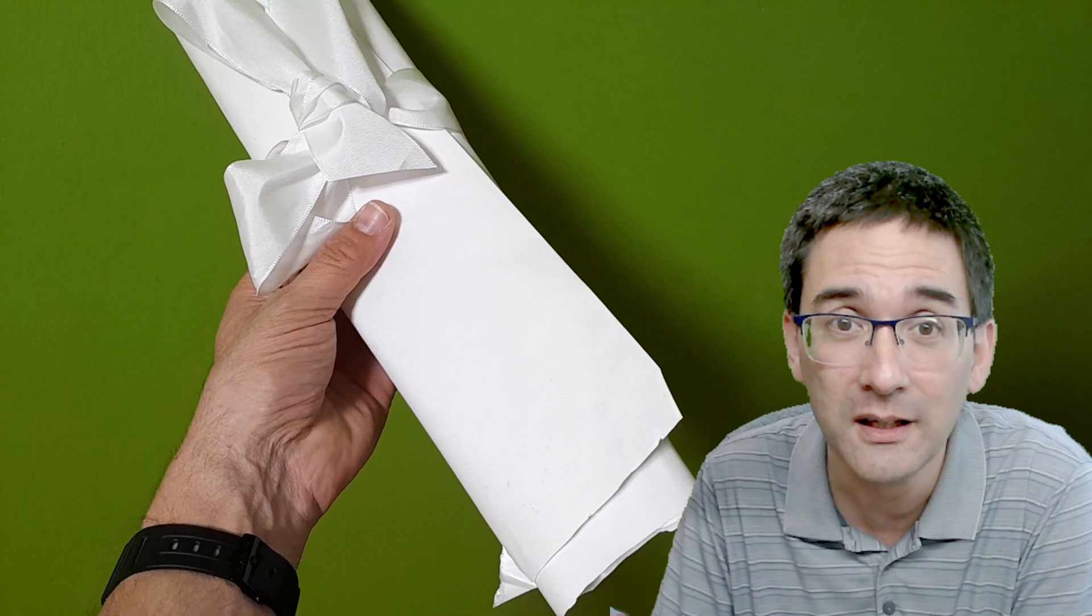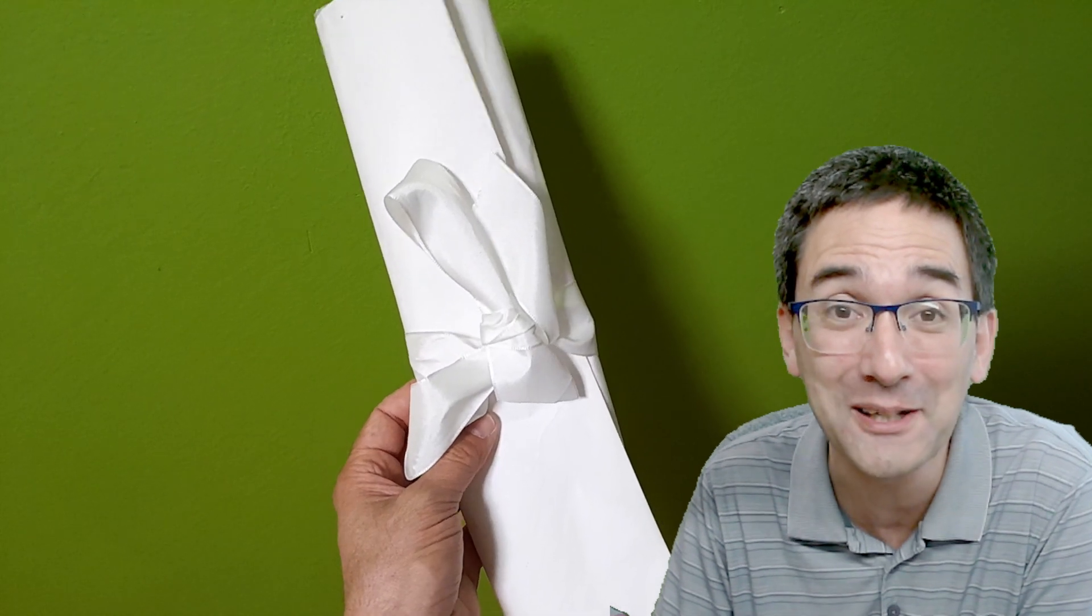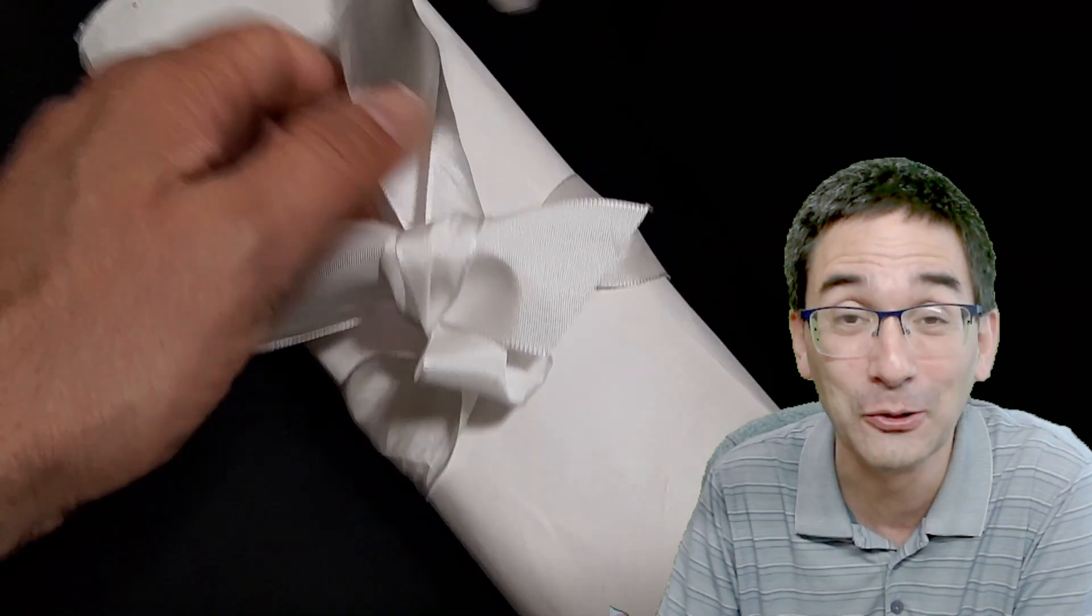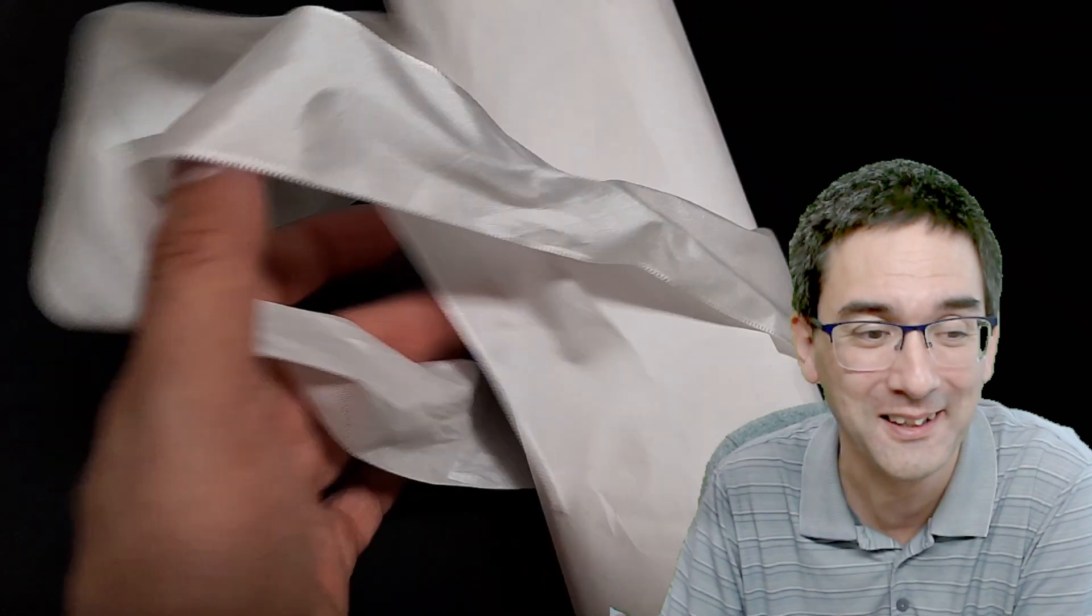In order to assess how many mites there are in a beehive, you do a little assessment by collecting these mites. This is basically what they've done, and she's given it to me to make a YouTube video. These are the presents that I like a lot. I have to tell you, it's probably one of the most unique and unusual presents that I ever got.